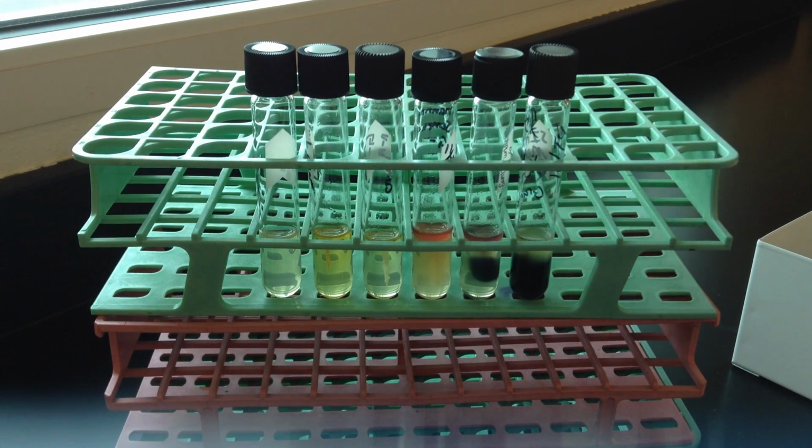The other piece here is indole production, and indole is a waste product that will build up if the organism has the enzyme tryptophanase. And tryptophanase is in the class of deaminase enzymes, and it breaks down tryptophan. And it will produce various end products, but one of the ones that we're testing for here is indole. And so keep in mind, again, with SIM, as with a lot of our protein catabolism tests, often the pH is going up because of an ammonia end product. So that's common to see in there as well. So a little bit different from our carbohydrate tests, where the pH is so often going down.